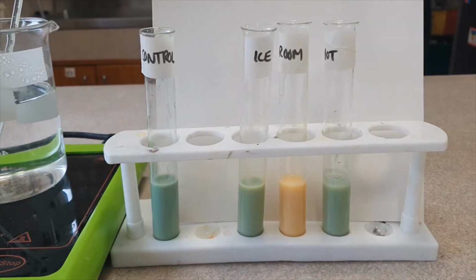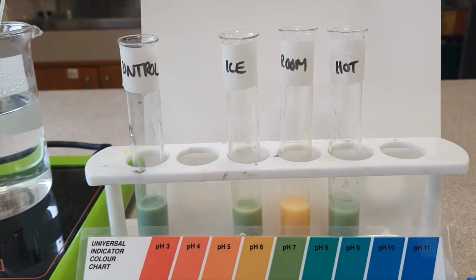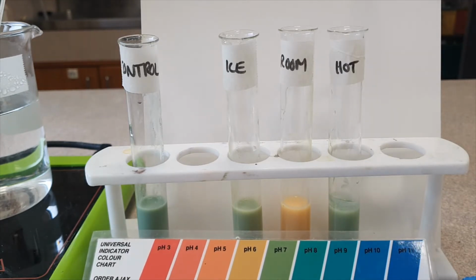Okay, so you can see some pretty clear reactions here. You need to write down what you think the pH of each one is. You can pause this video if you need, and then answer your questions.